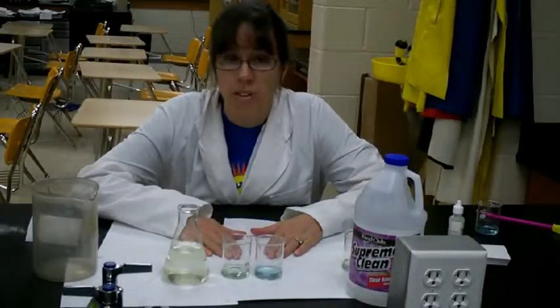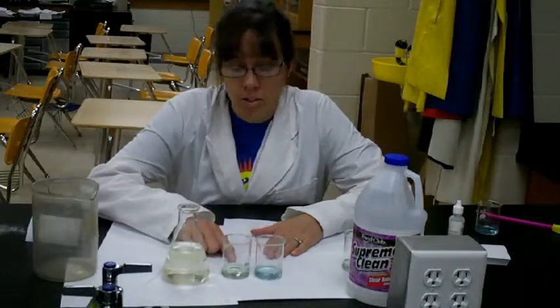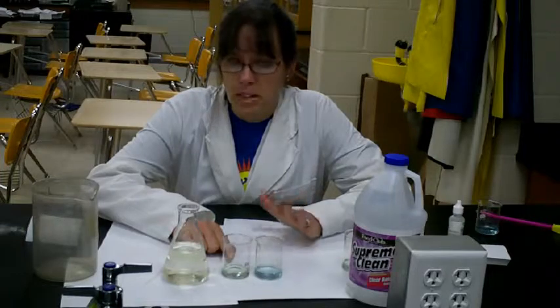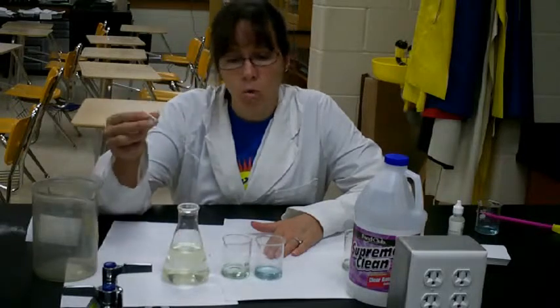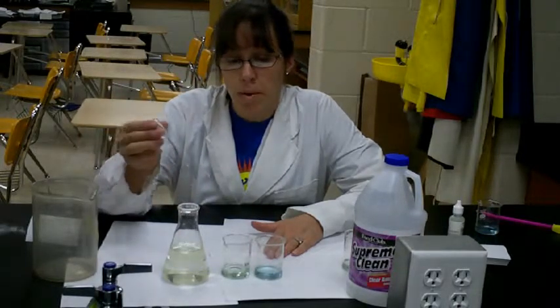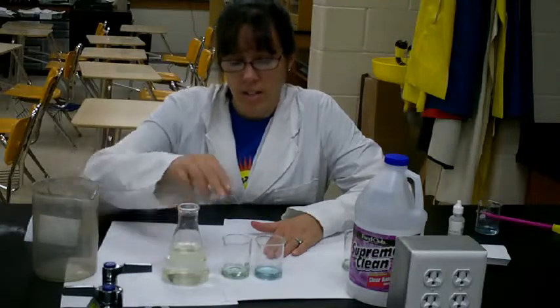And here we are, 85 drops of ammonia stock solution later. And you can see our volume in our jar here has increased a little bit, but I'm not too concerned about that, and the color change is getting fairly close. And when you get down to this point, warn your students that you're going to have to add drop by drop and give it a swirl.